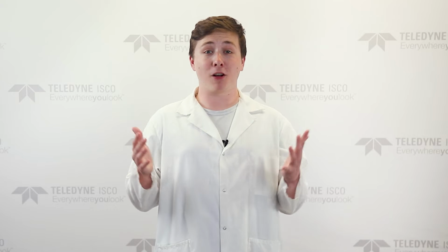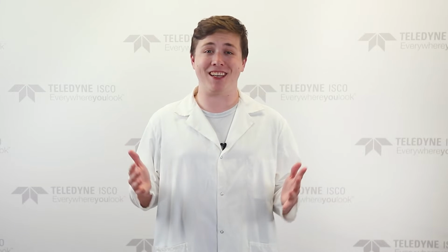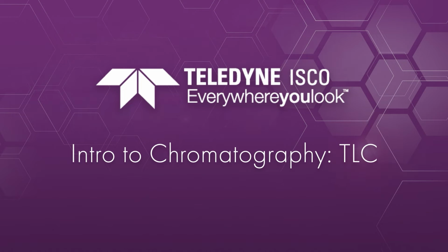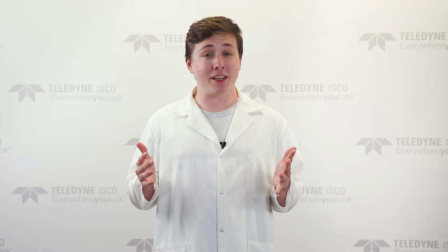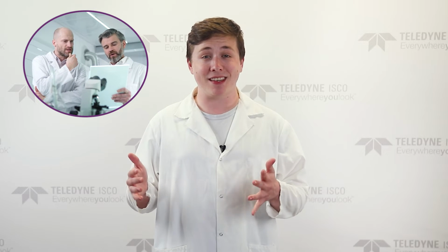In this video, we'll go over the proper method for conducting thin layer chromatography, or TLC. TLC is a technique commonly used in student experiments as an introduction to preparative chromatography. Scientists can also use TLC to identify compounds and detect colors in things like food items or cosmetics.